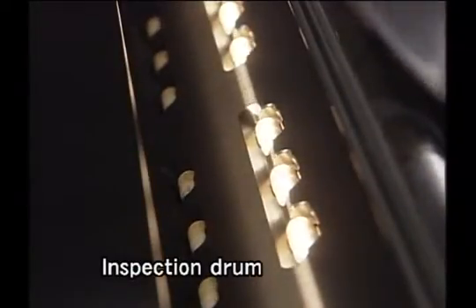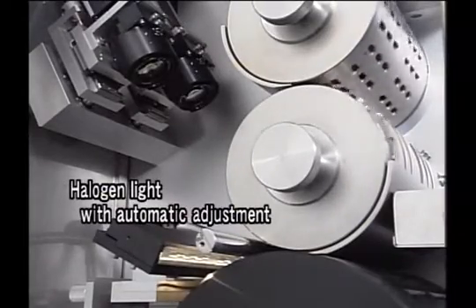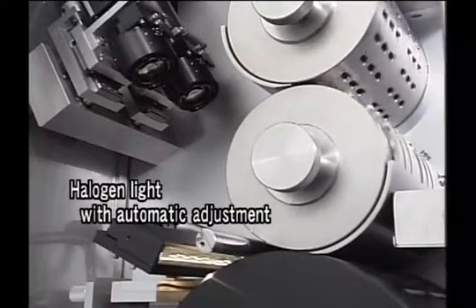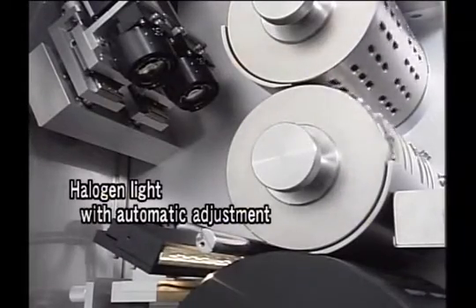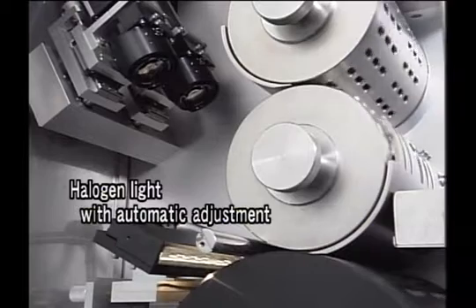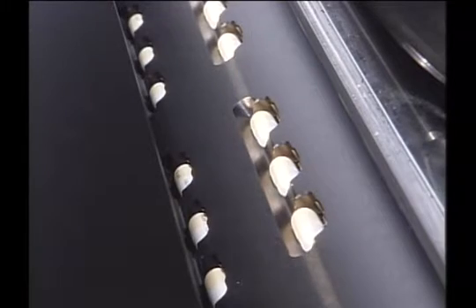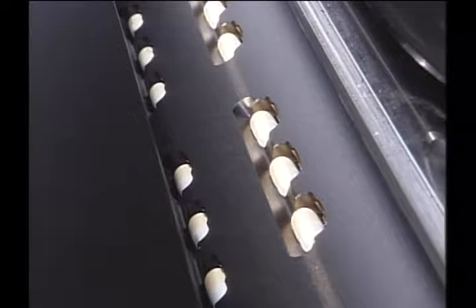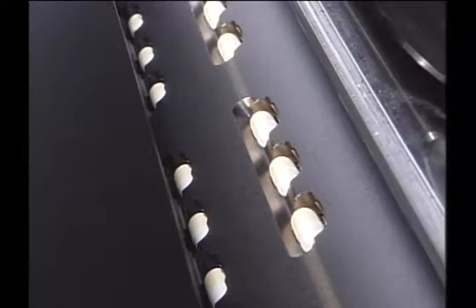Appearance inspection is done using a halogen light that features automatic adjustment and a 1024-element CCD line sensor camera. The capsules are rotated by the inspecting drum, which then stops for a short while. After speedily scanning as many as 200 times and introducing the image data, it is judged by a designated parameter.